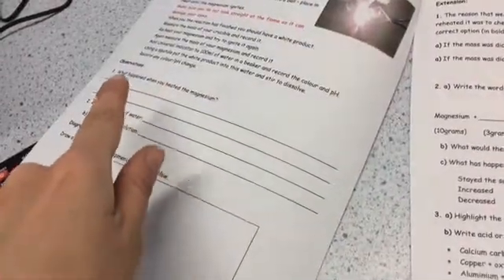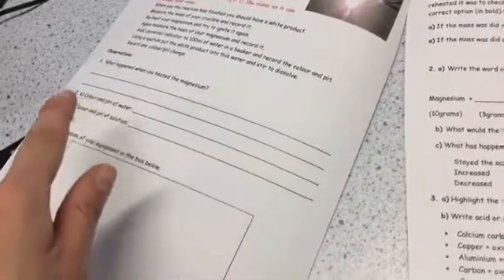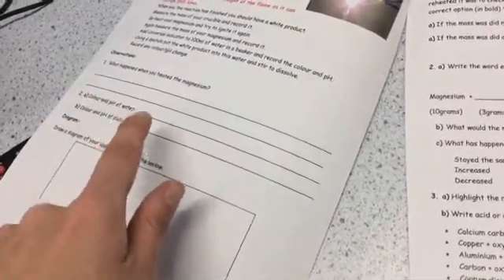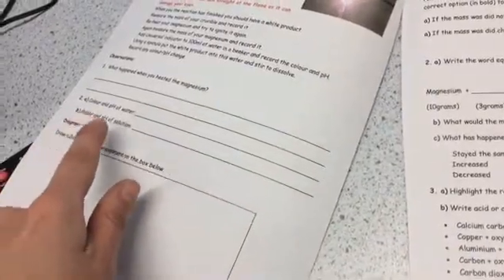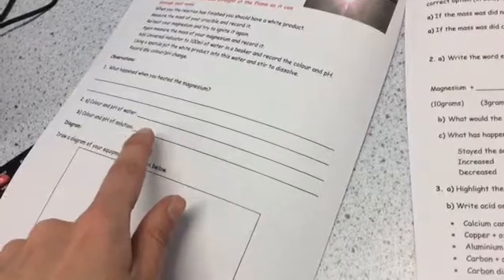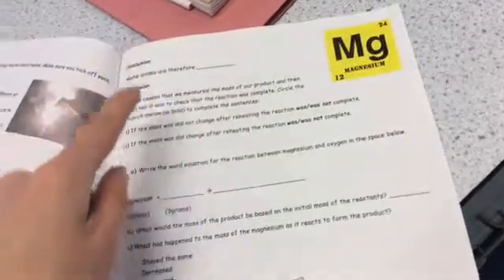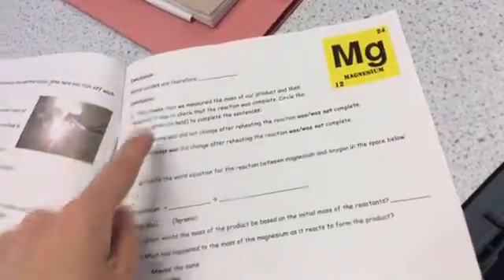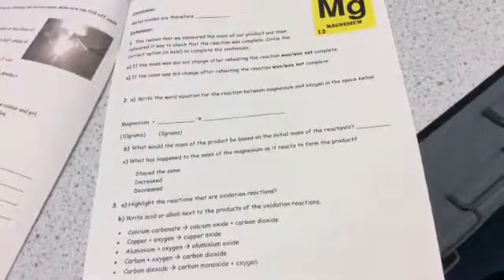So see if you can add your observations of what happened when you heated the magnesium. Now, it says here color and pH of water. pH of water is 7, it should be neutral. But then you can do the pH of the solution we made with the magnesium oxide in, because you just saw that. You can draw the diagram, because I showed you how to do that. And then there's some, there's a conclusion and some extension questions. Hopefully, you should be able to do all of those using the video.